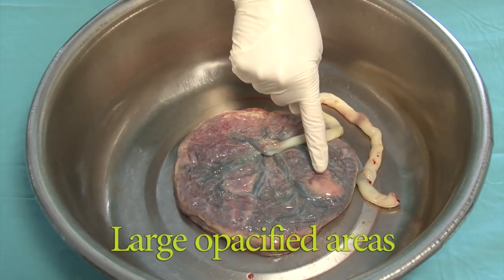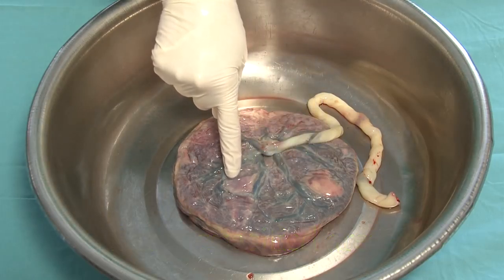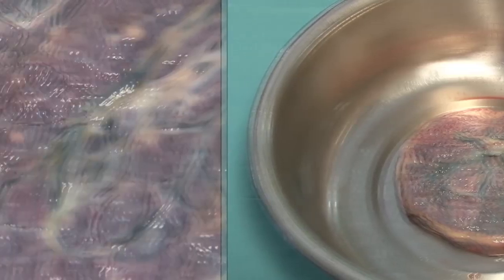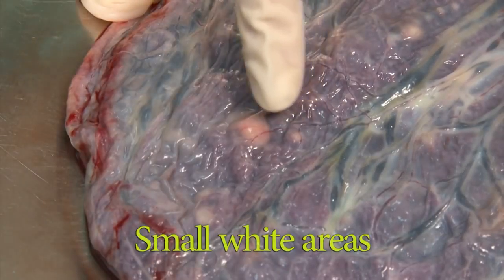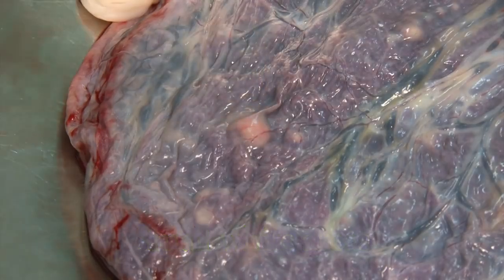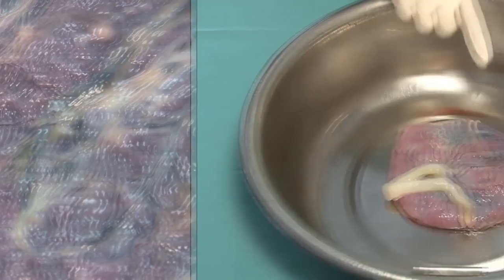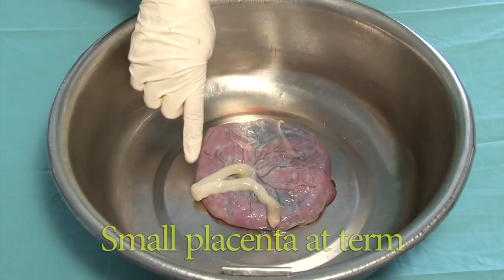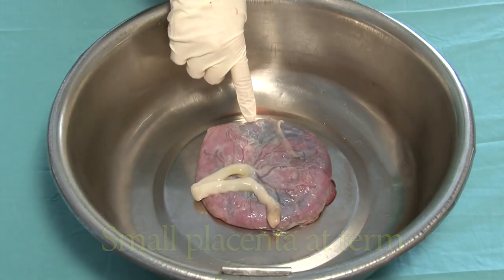Here are two large opacified areas which require histological examination for further assessment. Small white areas are quite common and could be caused by subamniotic yolk sac remnants, fibrin deposition, or infarcts. This is a small term placenta compared to a normal placenta weighing about 500 grams.